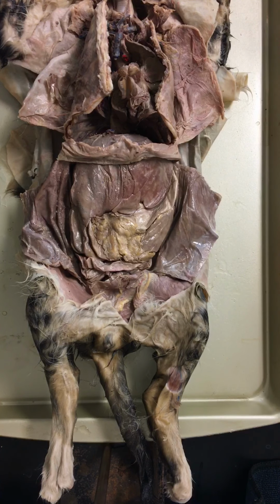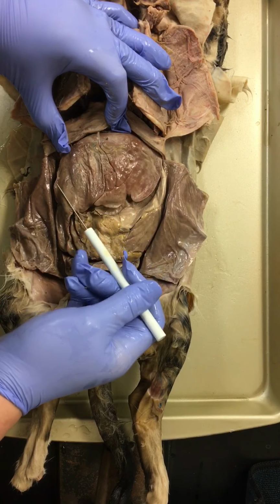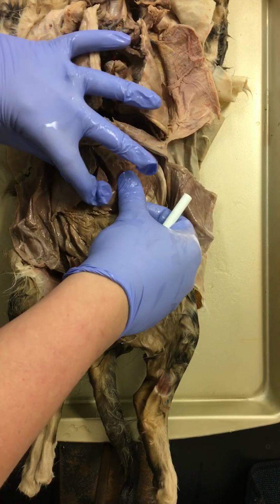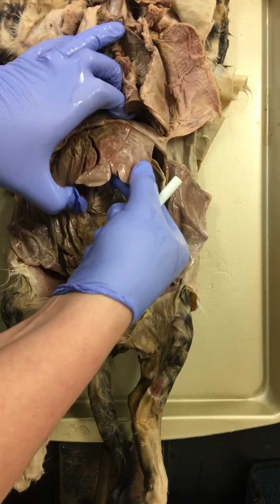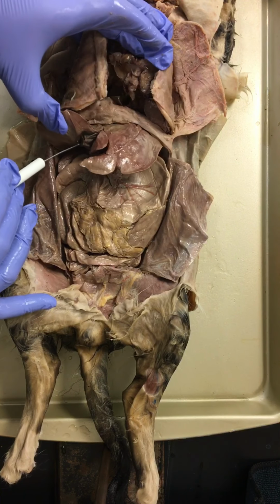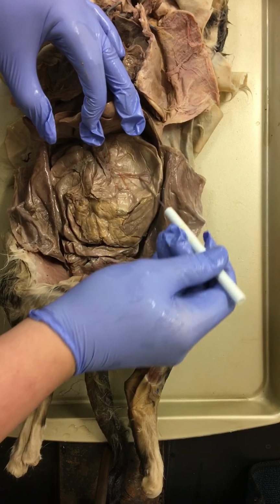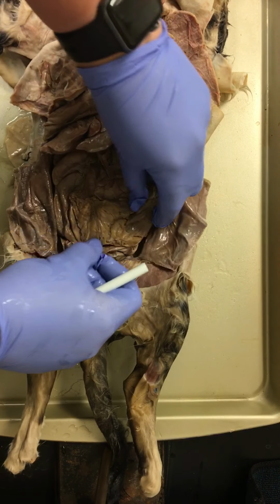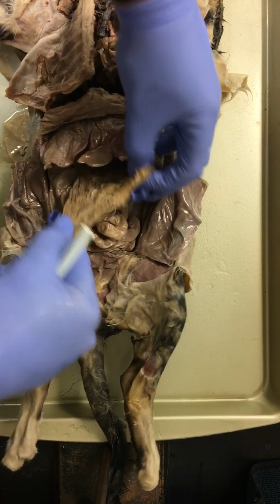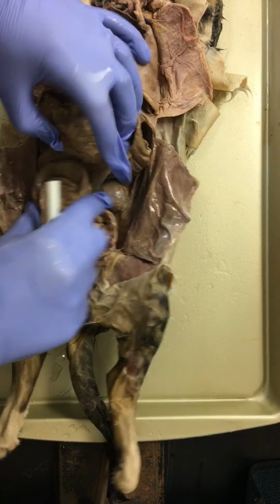We can see a few things right off the bat here, easy to spot. This large organ here is the liver. The liver has multiple lobes, and inside of the liver, we do have a nice sac-like organ here. The bottom side, I'll move my finger, that is the gallbladder. From there, we can lift up, we can see the stomach. This right here is the greater omentum. The greater omentum is kind of covering our small intestine, which is here.